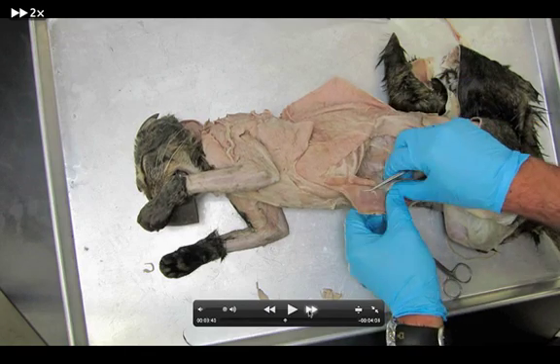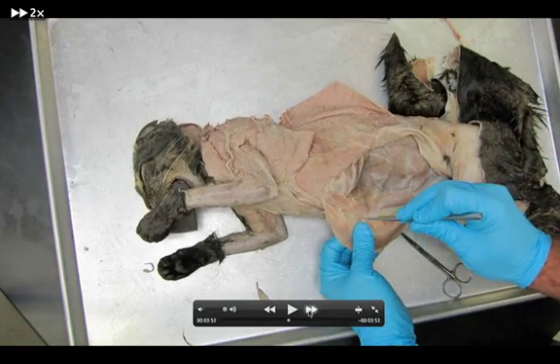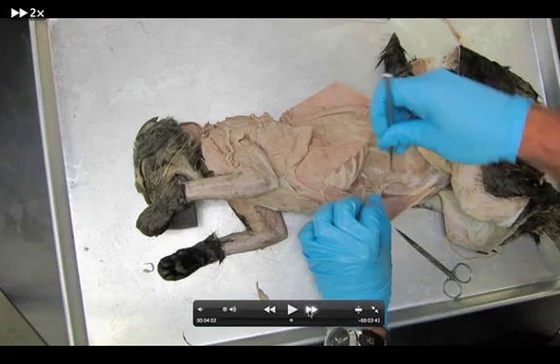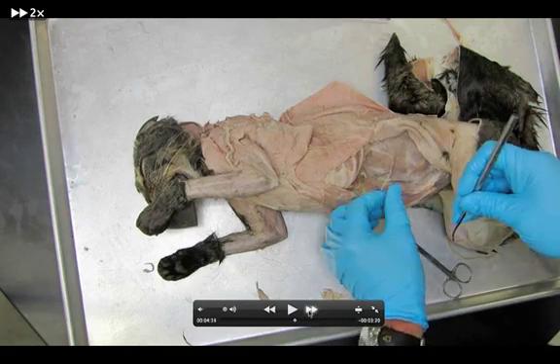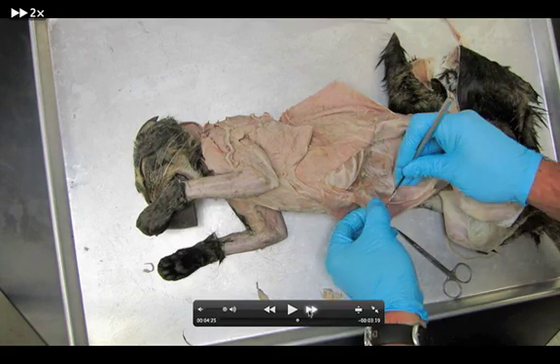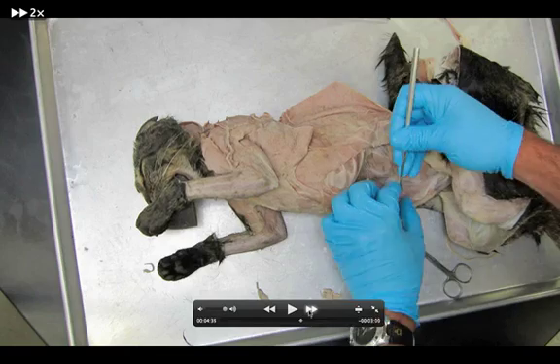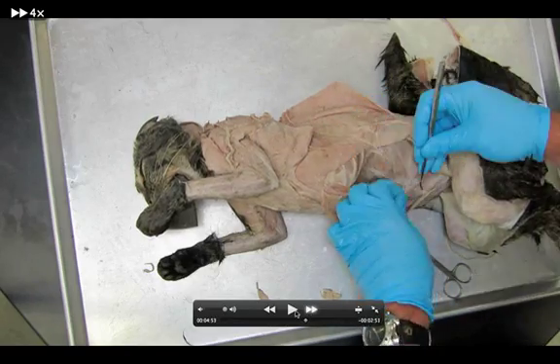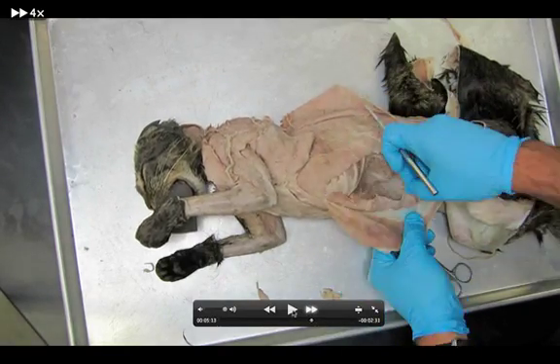It's what we call your six-pack when people have a six-pack. Freeing it up. Notice on this side down here by the navel or the belly button, the rectus abdominis is most likely attached to the internal oblique on the body side of the cat — it won't lift up with the external oblique as you lift it up. So we'll get under the rectus abdominis, keep freeing them up. When you're all done, you should have a nice little ribbon kind of set up there.